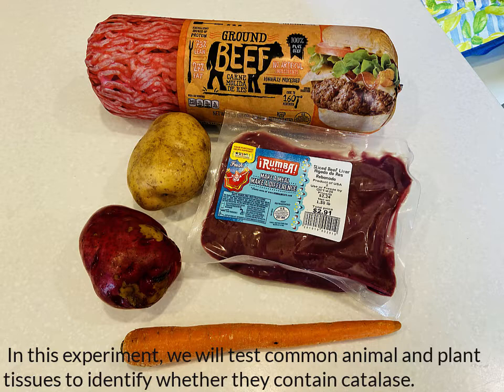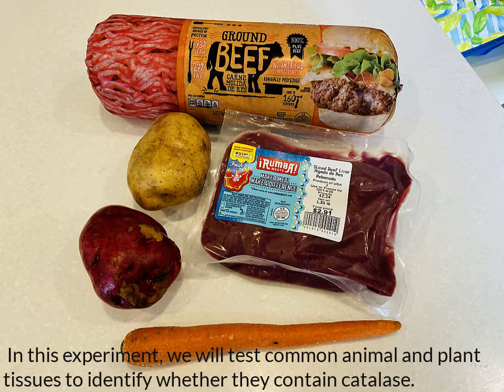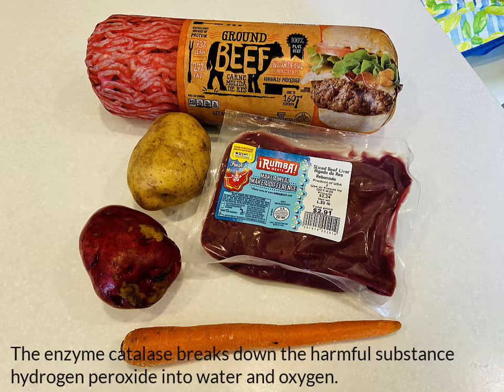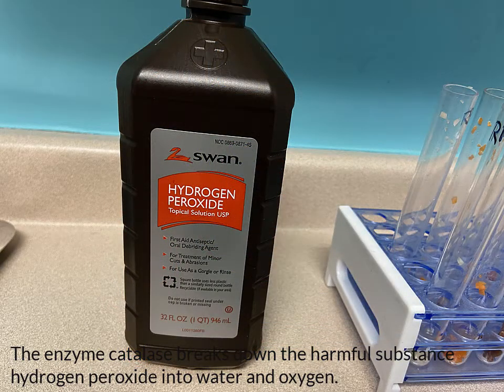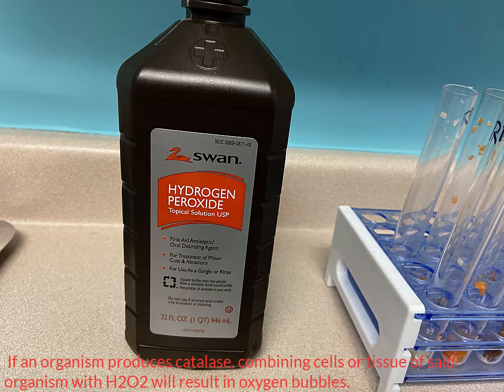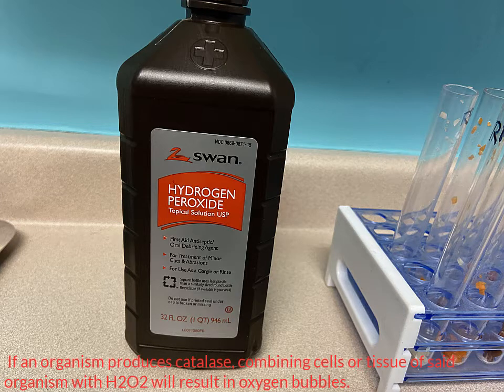Hello biology students. In this experiment we'll test common animal and plant tissues to identify whether they contain catalase. The enzyme catalase breaks down the harmful substance hydrogen peroxide into water and oxygen. If an organism produces catalase in its tissue, combining some cells of that tissue with hydrogen peroxide, H2O2, will result in oxygen bubbles.